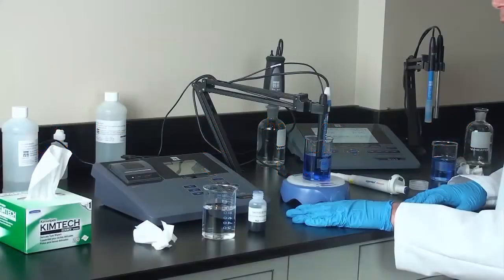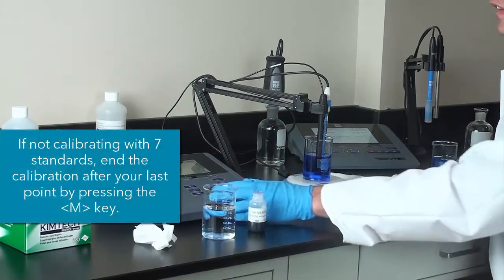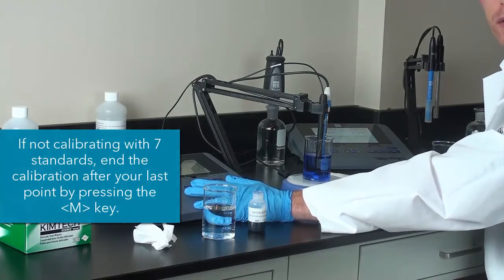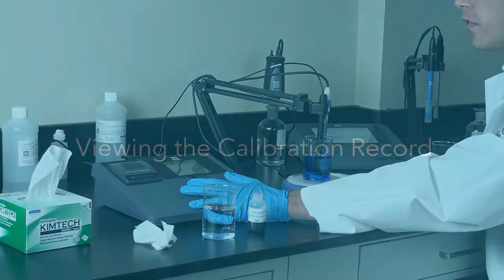So now that stability has been reached, we can end the calibration early by pressing the M key. We can continue on with calibration by going up to 7 calibration points. But for this, we are going to end it after 2.